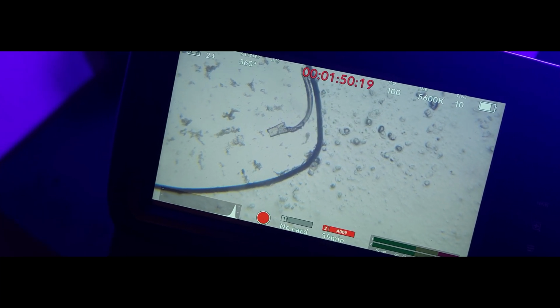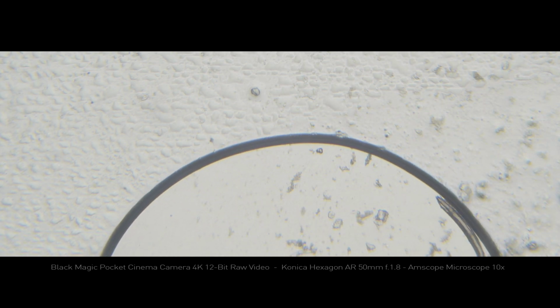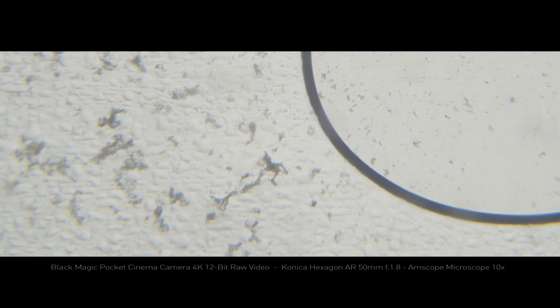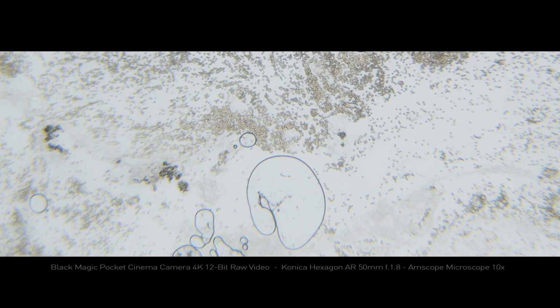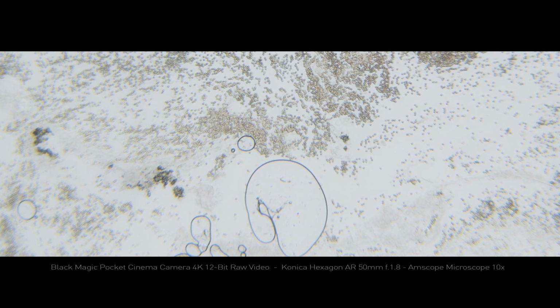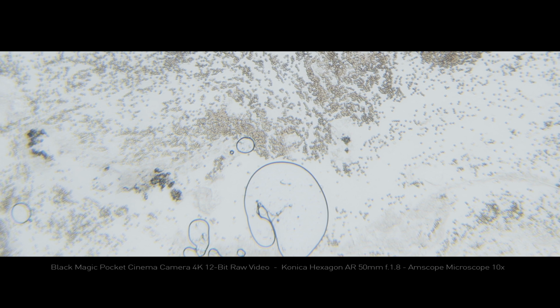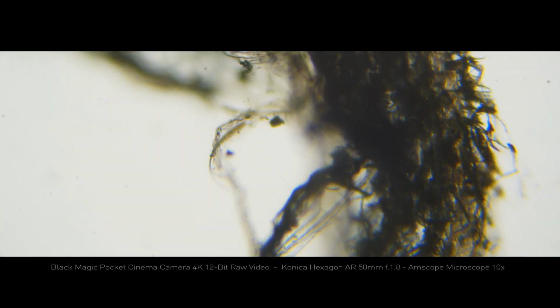I'm using an AmScope beginner microscope. It comes with three lenses, 4x, 10x, and 40x magnification. Focusing is a big challenge when you're magnifying this much, because microscope lenses have an extremely narrow depth of field. It means even a tiny camera vibration will mess up your focus. That's why you need a solid, stable ground and strong light for successful focusing.